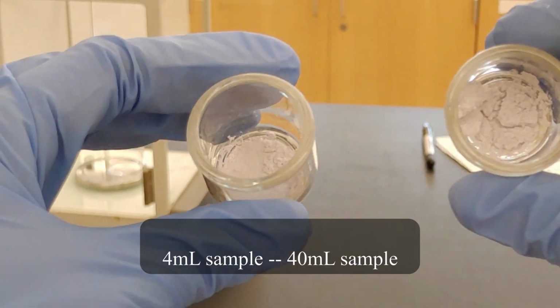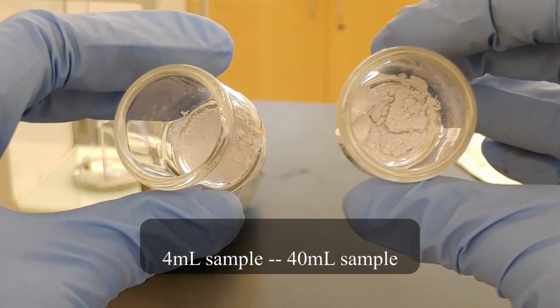Observe the difference in how much product was obtained from the 2 trials.